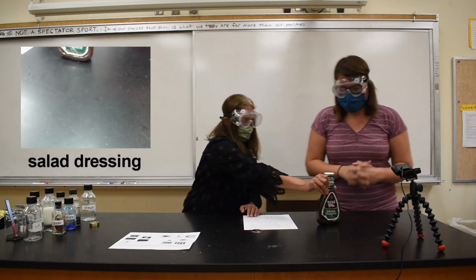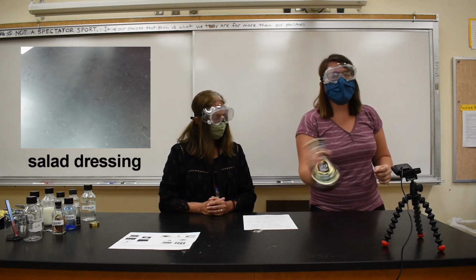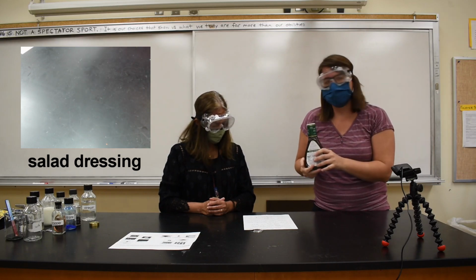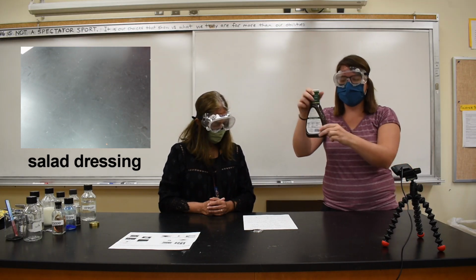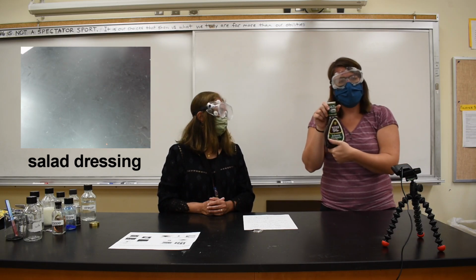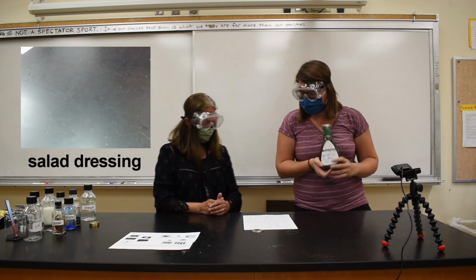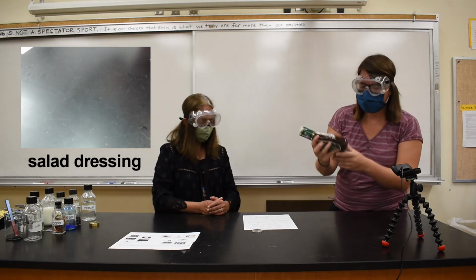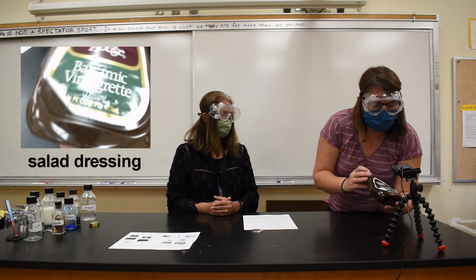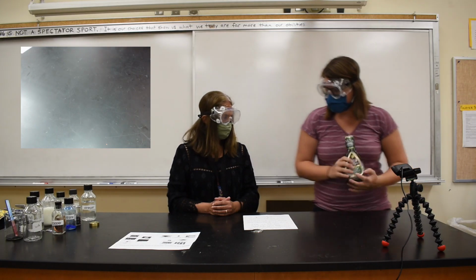All right, we have one more substance. One more substance we have is salad dressing. A little bit ago we shook this up, and so it hasn't quite settled into layers, but when we first got this substance out today, it was in 2 layers. One of them was at the bottom and that was a little darker colored. And then the other one was at the top. But when we shook it up, it mixed all together and stayed that way for at least a little while. It's like a brownish liquid. It's a little bit opaque. You can't really see through it. So that's salad dressing.